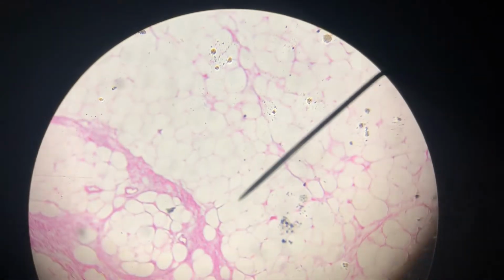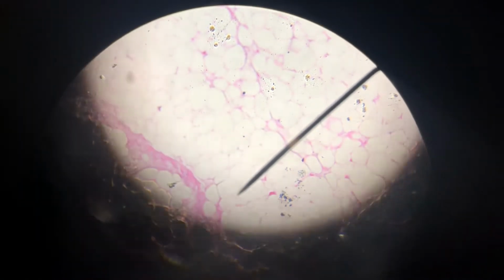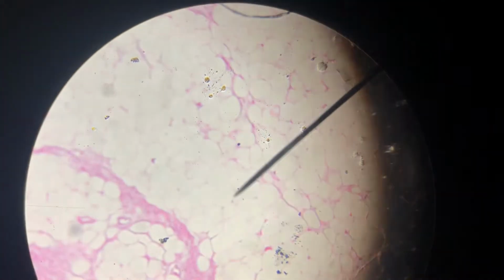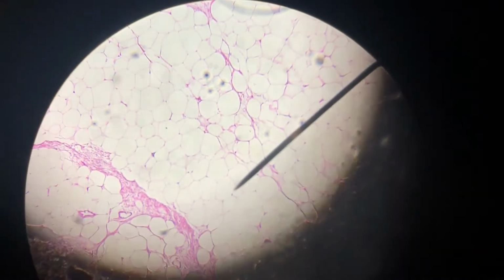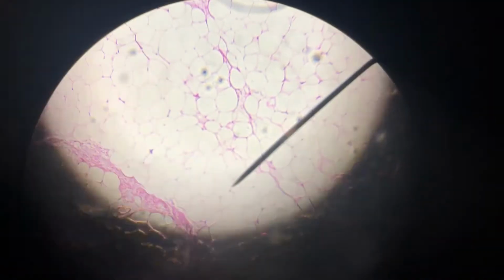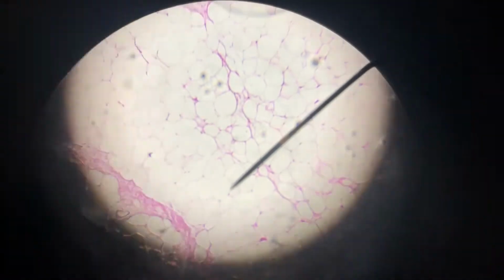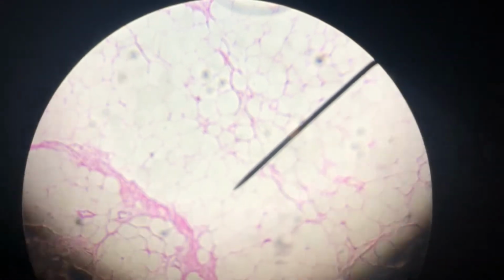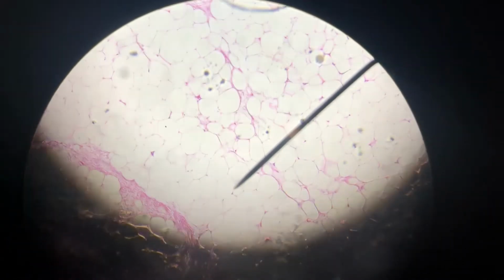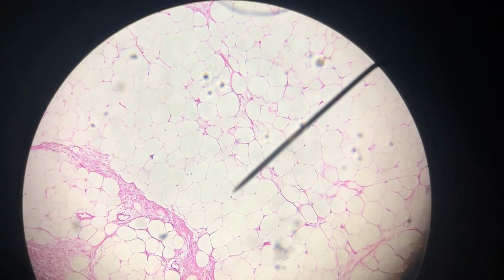Okay, this is adipose tissue, and if you look at it, it actually kind of looks to me like simple squamous epithelial tissue, and that's because adipocytes, the adipose, doesn't really take up dye. And so let me see if I can make this a little darker. Whoa, that did not work. Foiled my plans. But since fat doesn't take up dye, you can just see this real thin plasma membrane, and the nucleus gets squashed to the side.